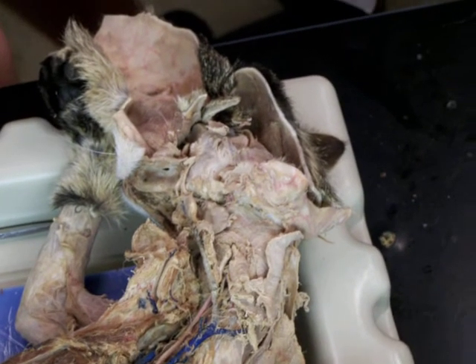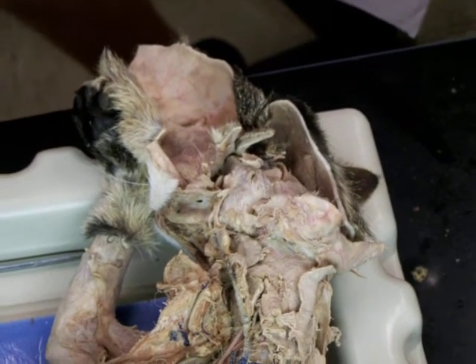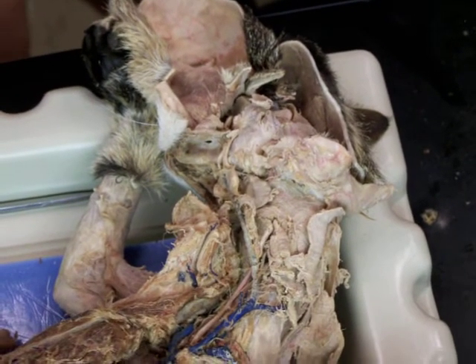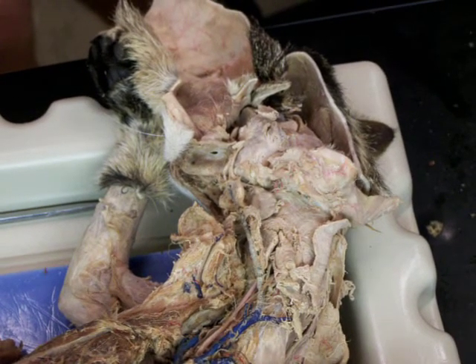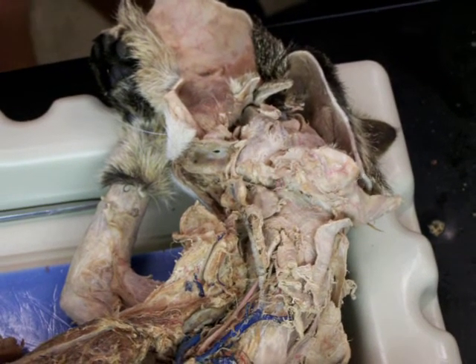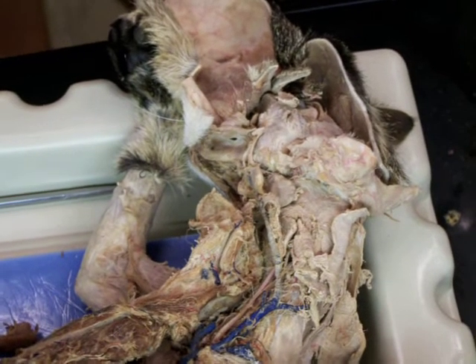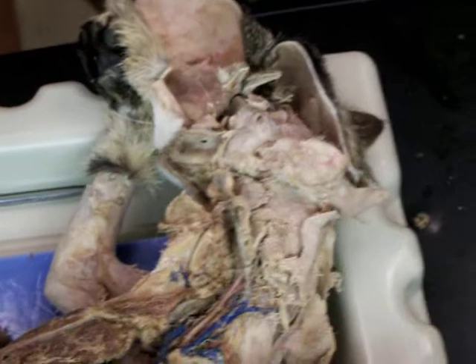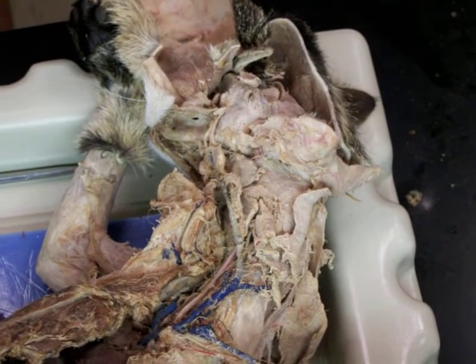That's the occipital, you said? No, that's the caudal auricular. Oh, okay. The occipital goes to the base of the skull, right towards just lateral to the foramen magnum, and it's deep. Okay. It's like to the muscles that extend the neck. So you remember where those go, and you can see.